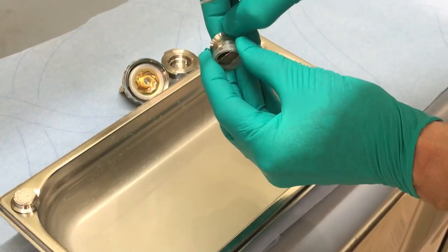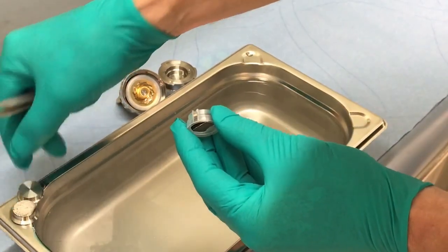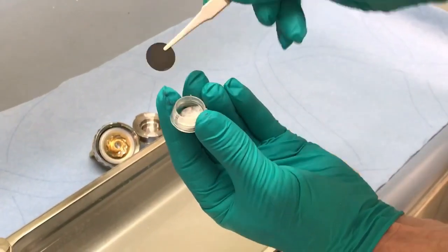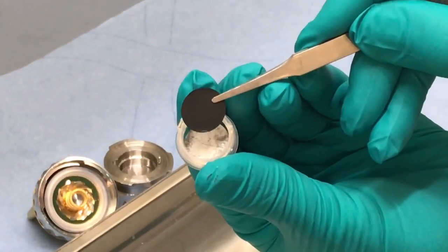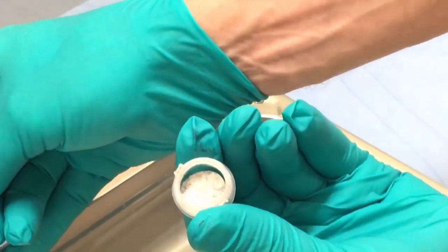Now I remove the lower plunger. Here you see the aluminum side of the NCM electrode, and the black side is the NCM active layer, which has not changed in appearance since the beginning.